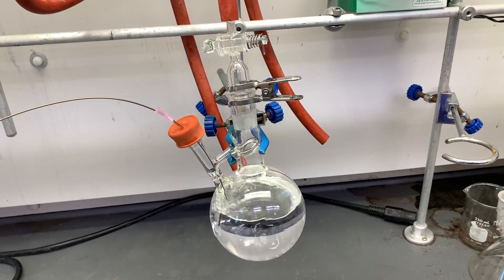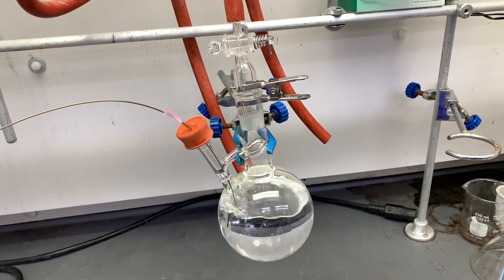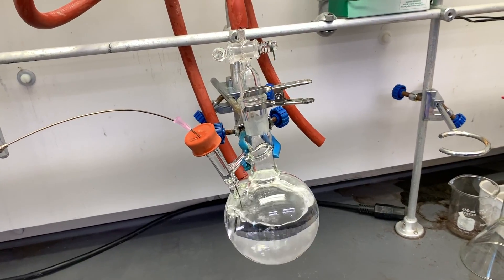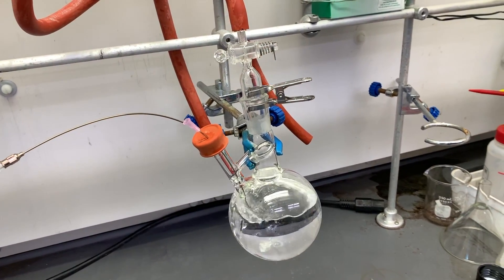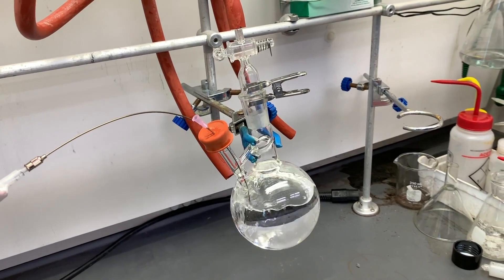Only sparge a liquid if it's done in a fume hood, if the chemical is not especially hazardous, and if we can afford to lose some to evaporation—AKA it's cheap.